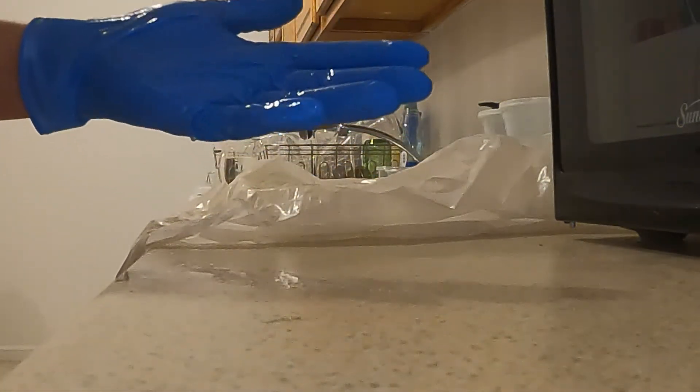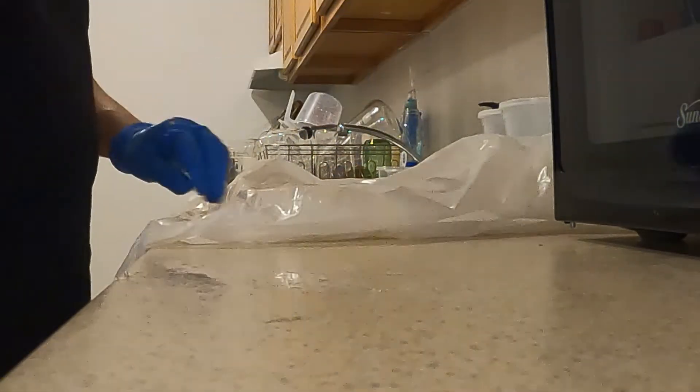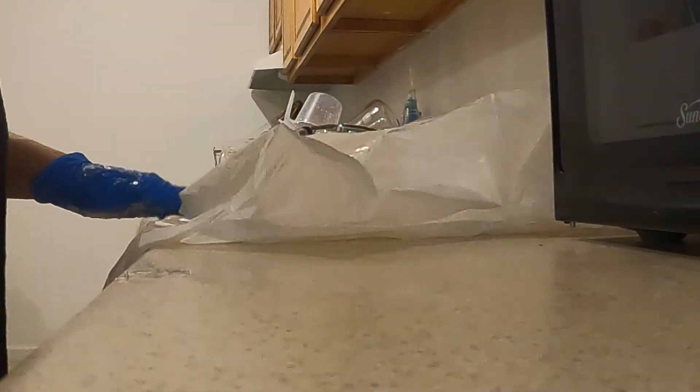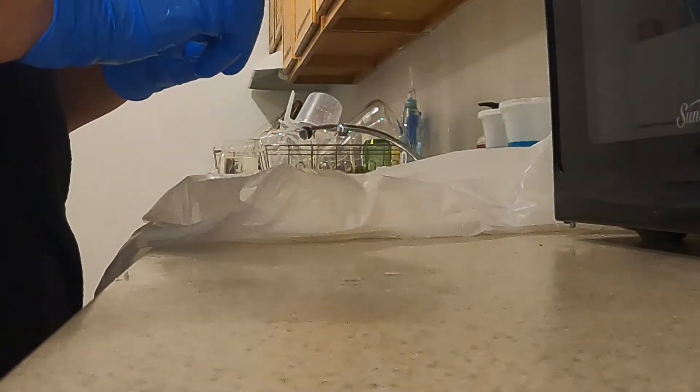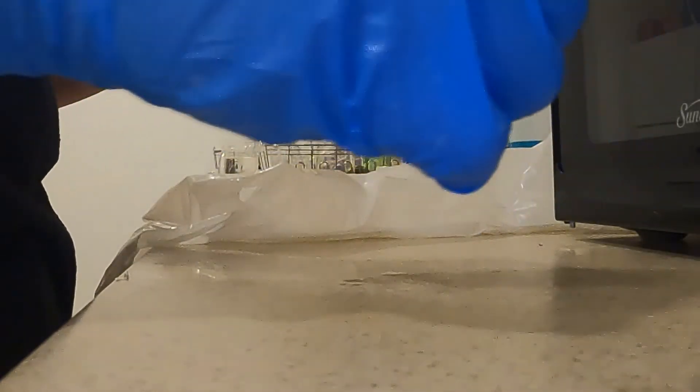I'm going to spray my gloved hands with the 10% bleach solution and I'm going to spray the inside of my garbage bag again. Even though it has been five minutes the media is still going to be exceptionally hot so I want to try and move as quickly and as carefully as I can to get the media from the microwave to the garbage bag.